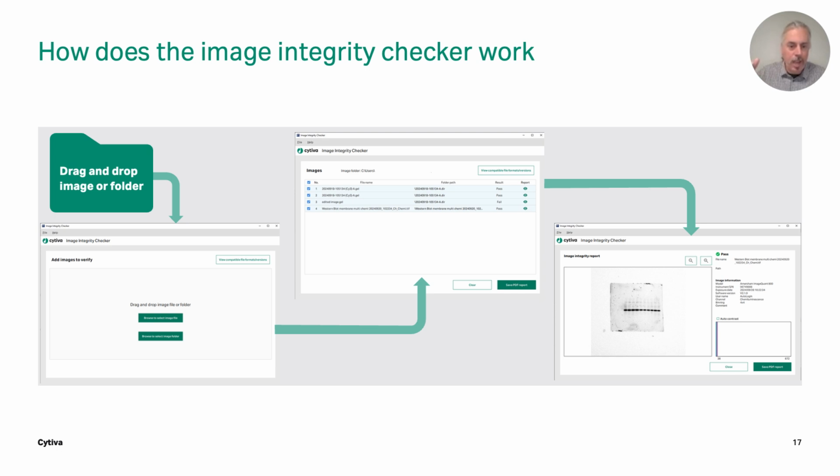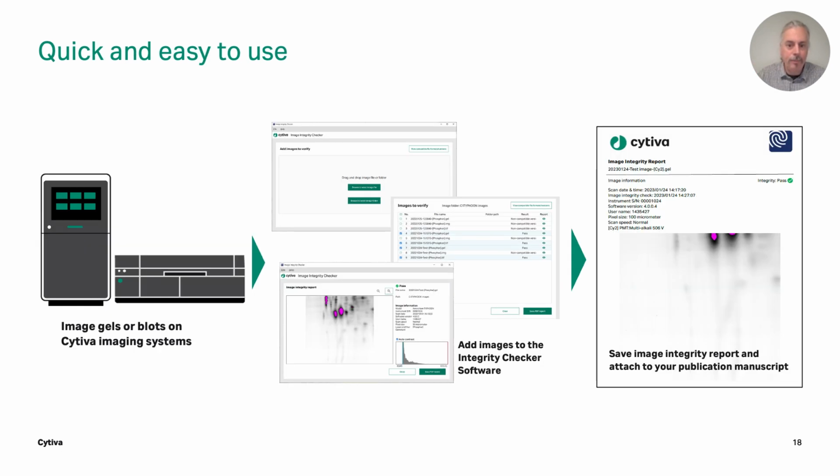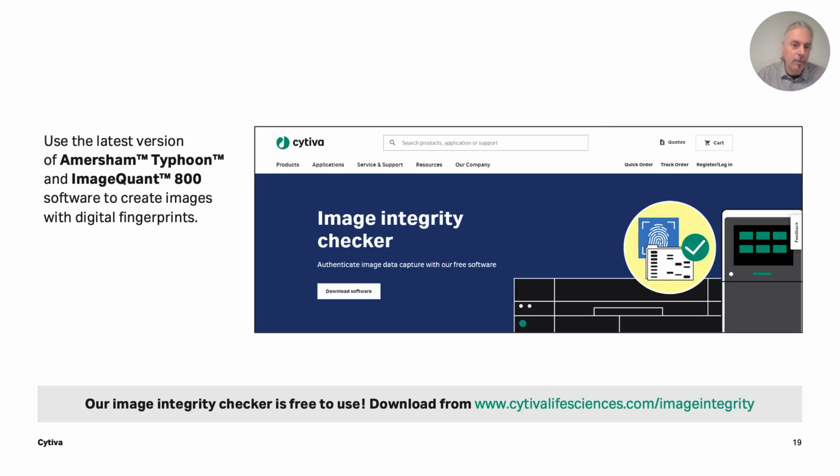But for the Amersham Typhoon and the Amersham ImageQuant 800, you'll get to the end and you can also generate this report you see here. So it's very quick and easy to do. Like I said, the images are coming from the instruments. They'll go into the free software package, the Image Integrity Checker, and then you have this report that's generated at the end, which you can submit with the data that you're submitting.